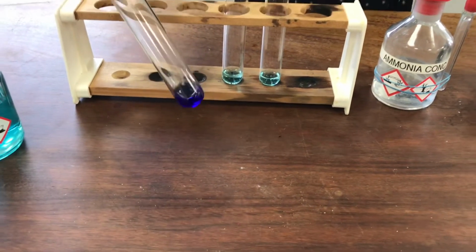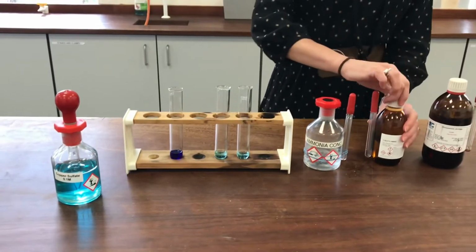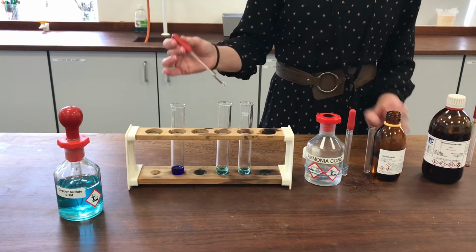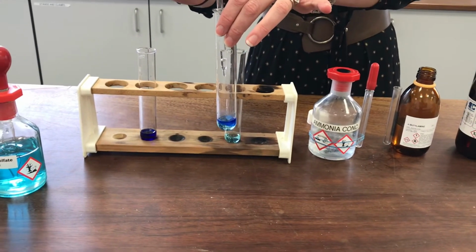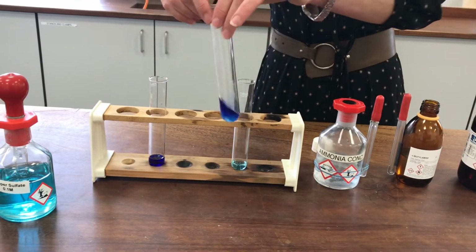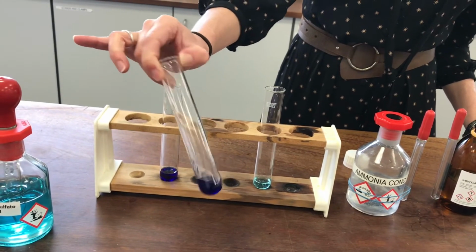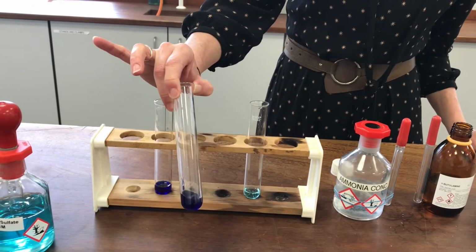Okay, so we'll have a go now at trying to add the other amines to the other ones and see what happens. So let's try butylamine and see if that will act as a ligand as well. You can see, look, it clearly is, and we've got a very similar, same even, really gorgeous deep blue colour to it. So all those water ligands have been displaced, and we've got something with the amine group on it acting as a ligand around the copper ion instead.